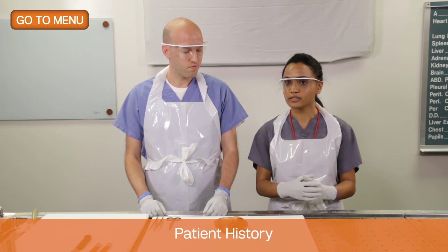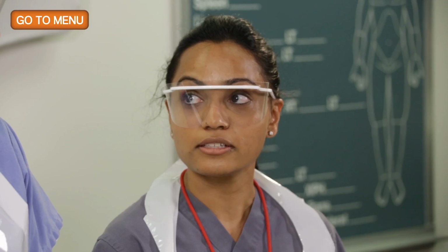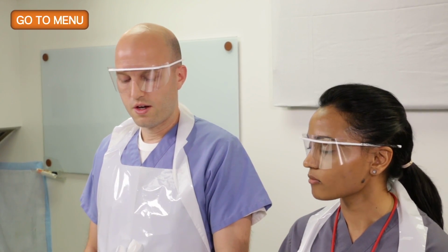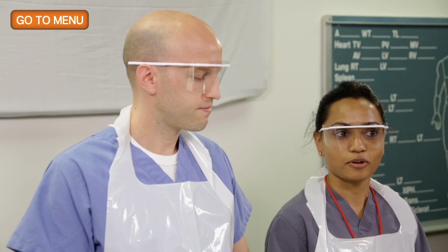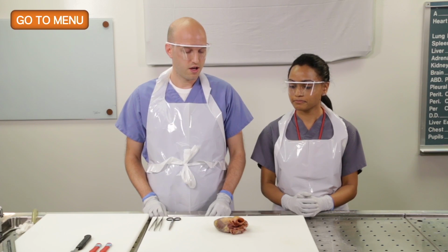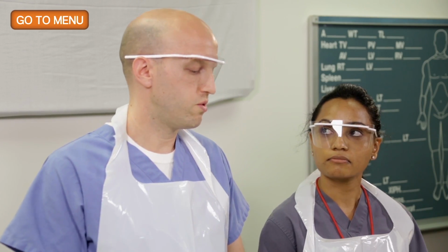Yeah, so this heart is from a 54-year-old male who has no known history of coronary artery disease, and he died of metastatic carcinoma. All right, so are we expecting to find much pathology in this heart? No, it should be a normal heart. Should be a normal heart, which happens at autopsy. People can die of multiple things. This guy did not die of a cardiac death, but nevertheless, we're going to show you how we dissect the heart. It's important to know the history because the dissection will be tailored based on the history. We're going to do the routine heart dissection in this case, which is centered around coronary artery disease.